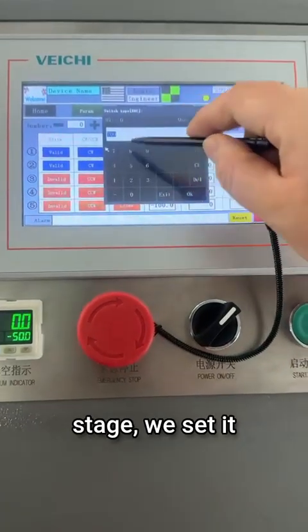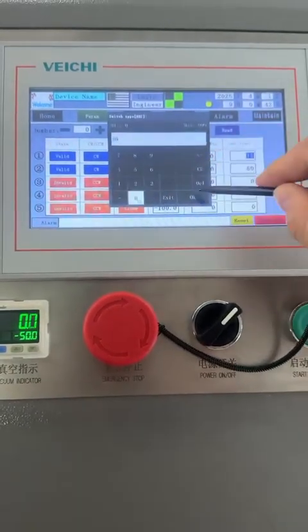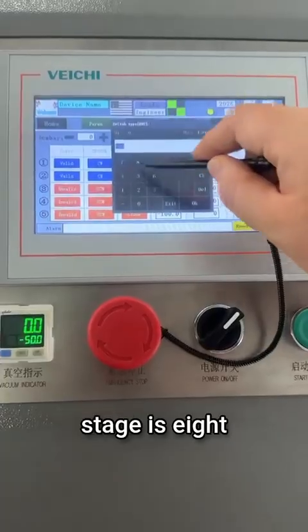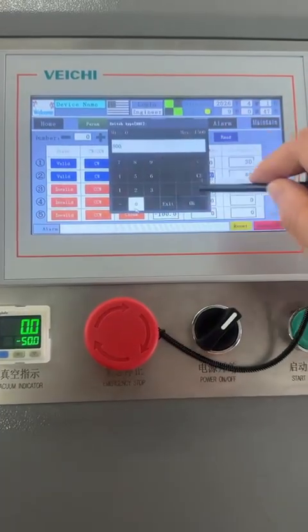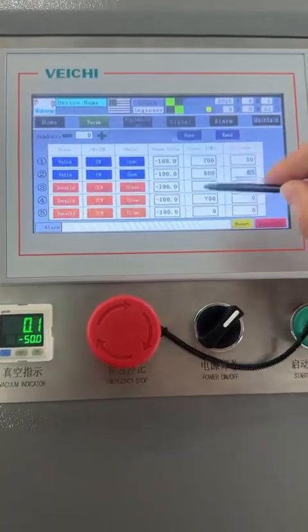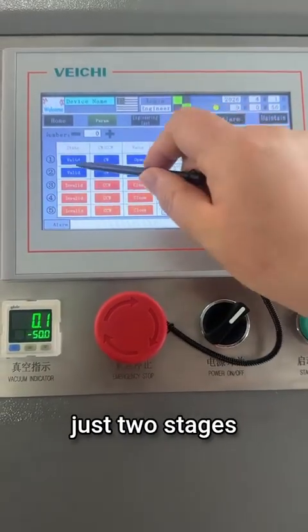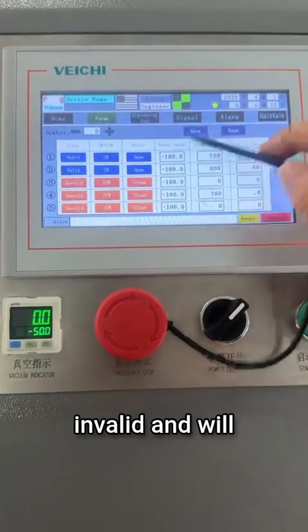For the first stage, we set it to, for example, 700. Click OK, then set the time to 30 seconds. Then the second stage is 800, then the time is 60 seconds. Click confirm. The entire process is a total of 90 seconds, 700 and 800, just 2 stages. The last 3 stages are invalid and will not run.